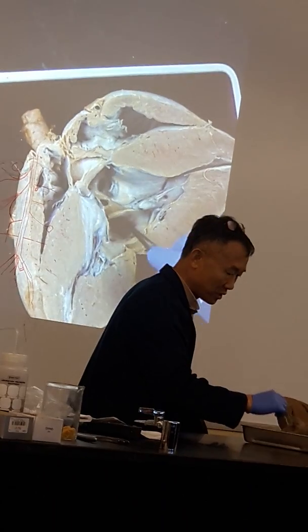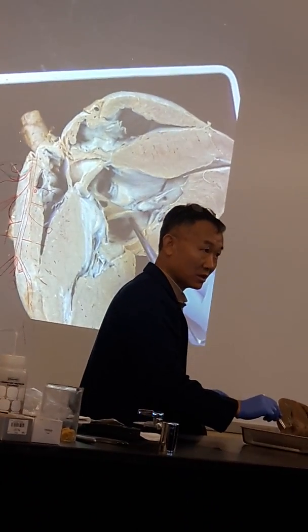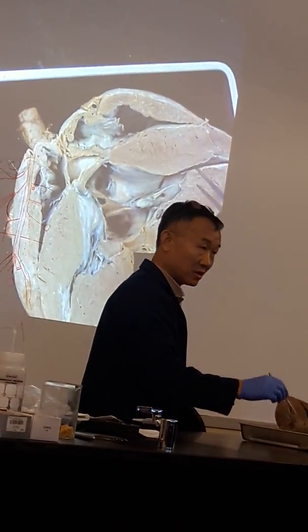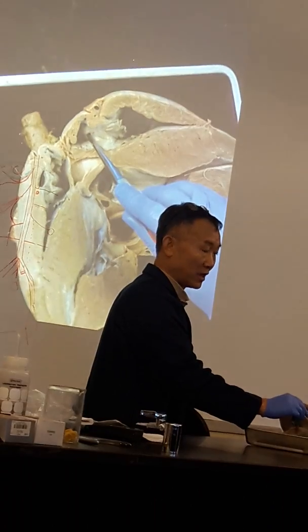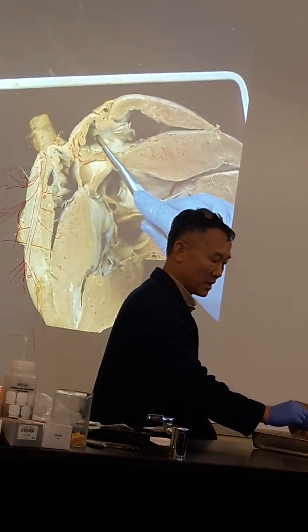And we may also point into the chambers. Like if I point to here, I will ask you what the chamber is. That's the left atrium, because it's above the bicuspid valve. It's above the left ventricle, must be the left atrium. If I point here, ask for this space, that's the right atrium. Okay?